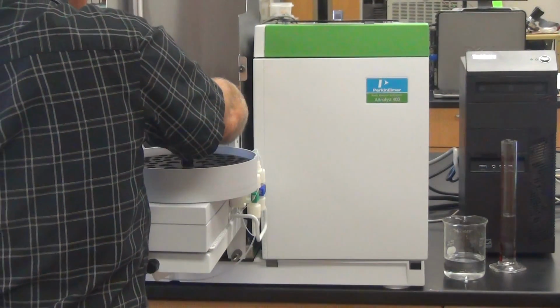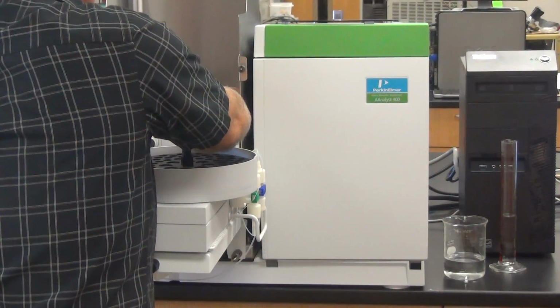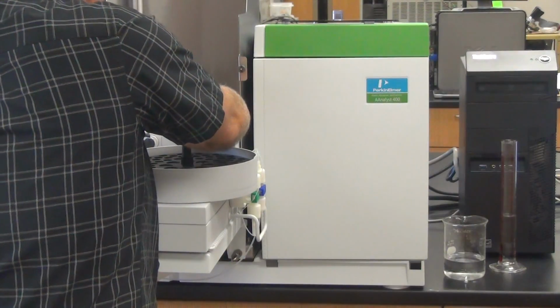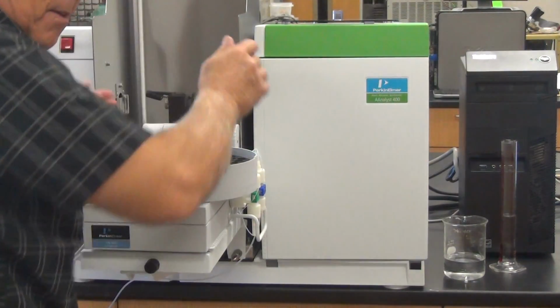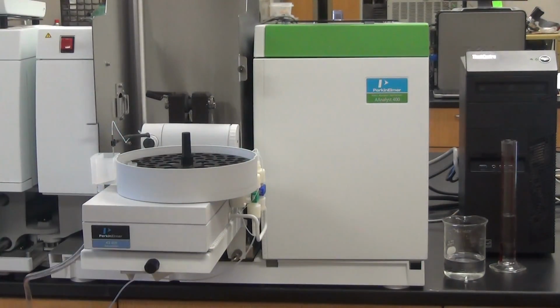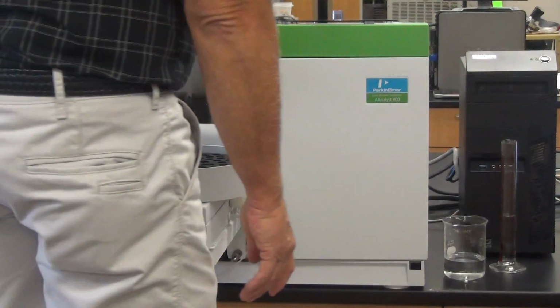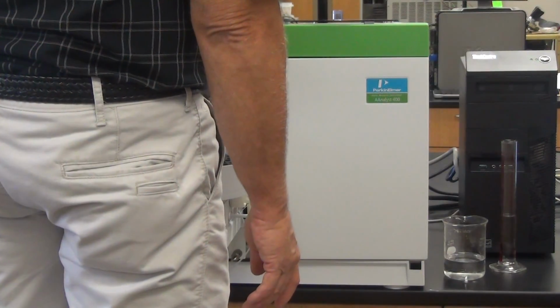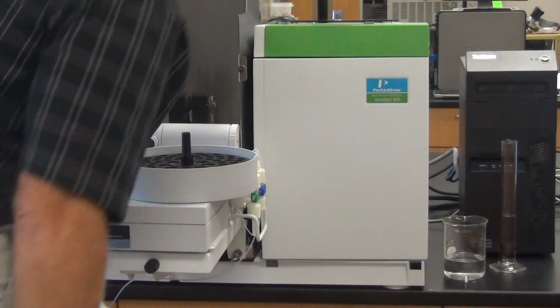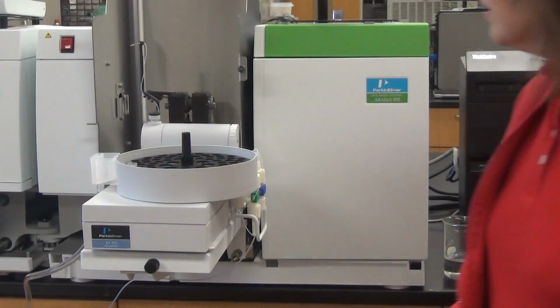Now, since I've moved this, what do we have to do? Now we have to realign the other side. Absolutely. So do I want to auto zero the graph or do I not care? No, the graph doesn't matter. There we go. So line tip, right? And then you wanna tell it in the furnace. So line the auto sampler tip in the graphite tube. Click next. Mirror.